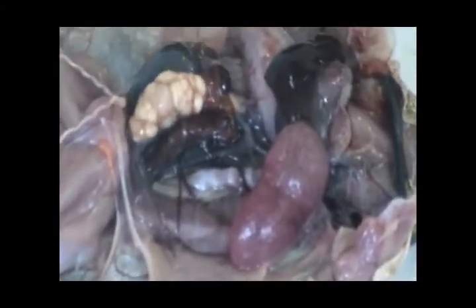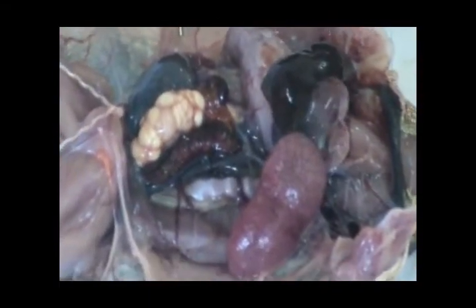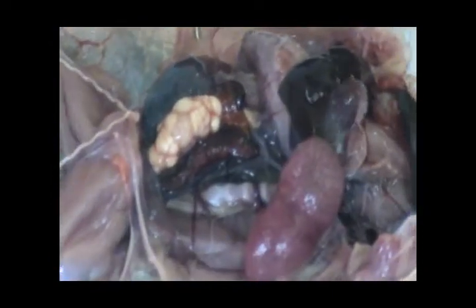So that's how the aorta branches below, in the duodenum region, that's how it branches.